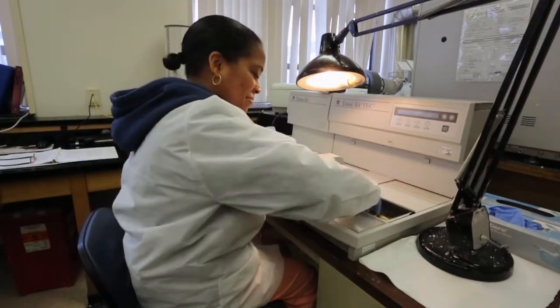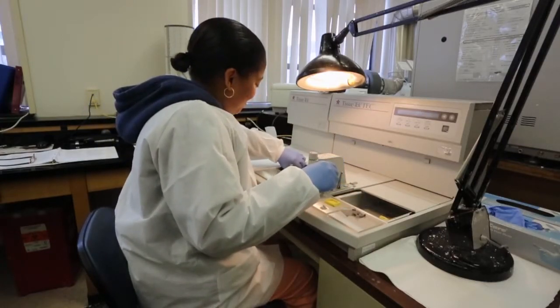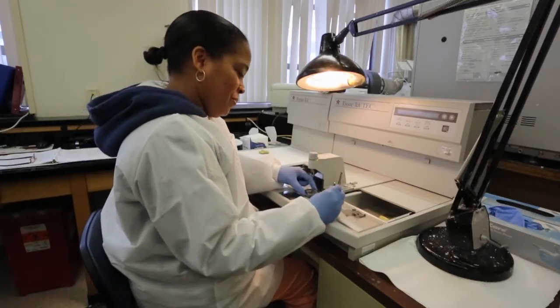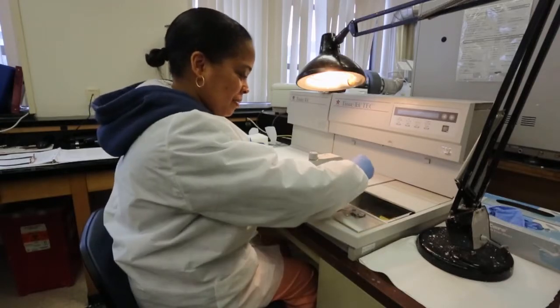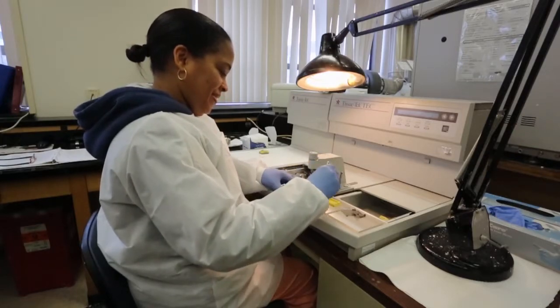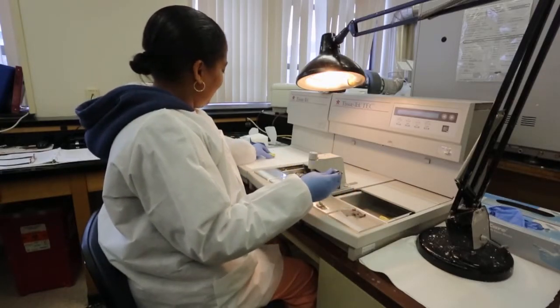The second one has more tissue, so we can use a bigger mold — a medium sized mold with two pieces of tissue — and we're going to line them up. Put them there and I'm going to use the bigger handle so that you can press down. Put the cassette on and move it over to the cold plate.